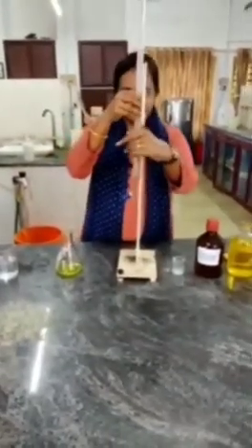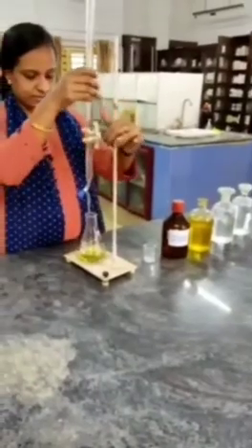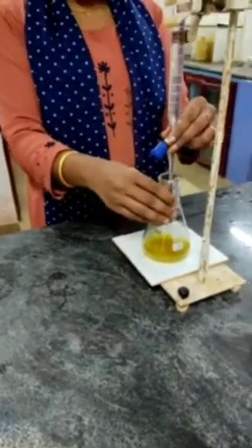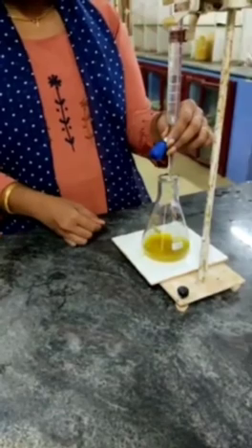The burette is filled with 0.0141 normal standard silver nitrate solution. Now the sample is titrated against standard silver nitrate till the pinkish yellow color is obtained. This value is marked as V1. The procedure is repeated for the blank with distilled water and note down the volume of titrate used as V2.